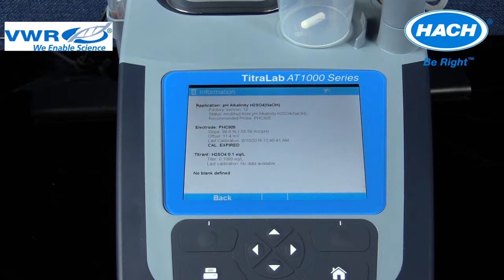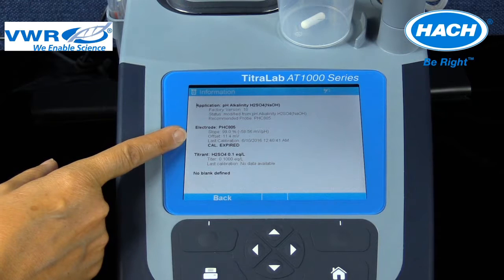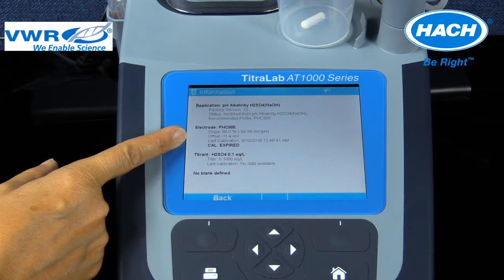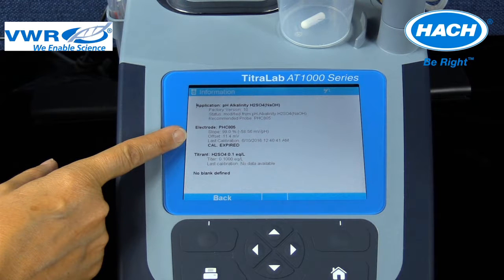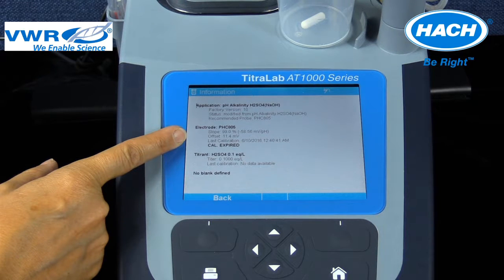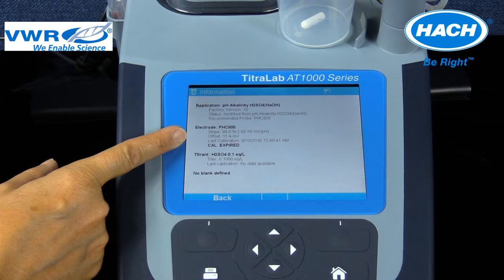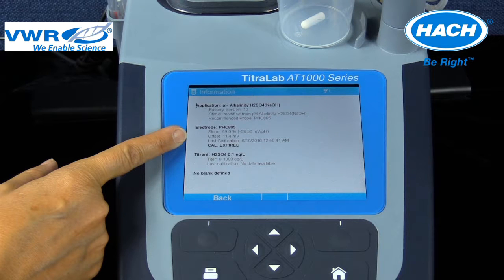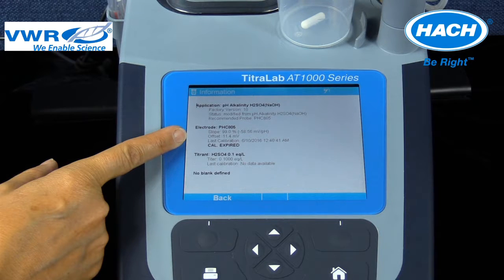From the information menu screen, valuable information on the electrode's last calibration date, slope, and offset is displayed. From this screen, the last calibration date of the titrant is also available.